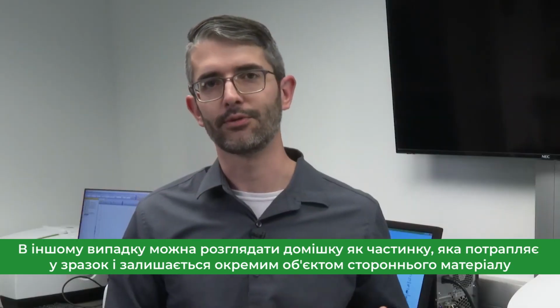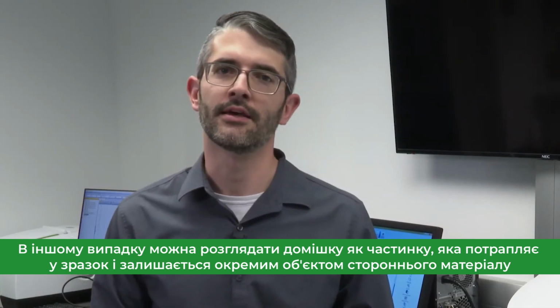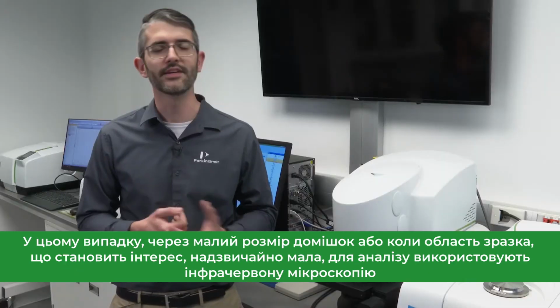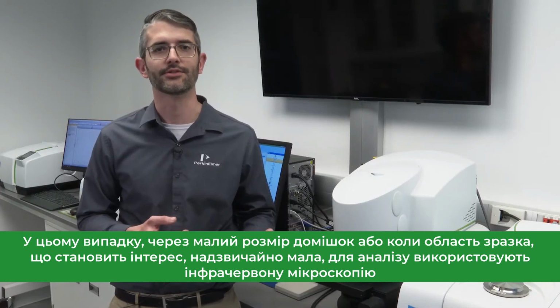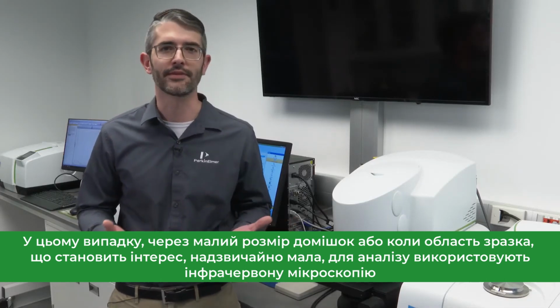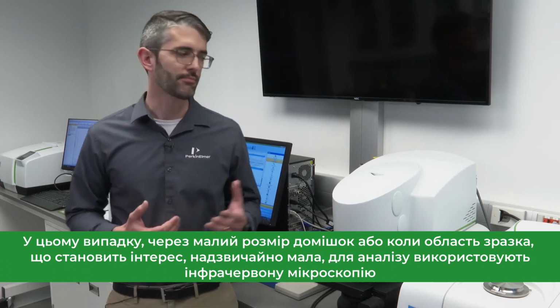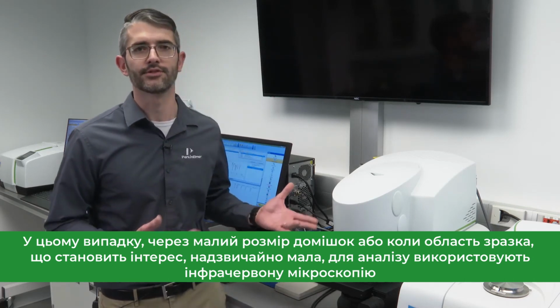In the other category, we can think of the contaminant as being a particle which falls in and remains a discrete body of foreign material. In this instance, because of its small size, or in other instances where the region of interest on a sample is extremely small, infrared microscopy is often employed for the sake of the analysis.